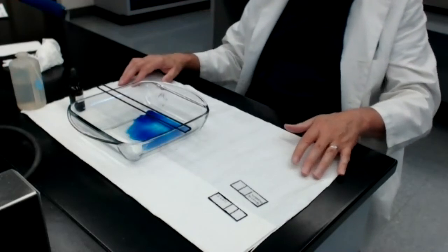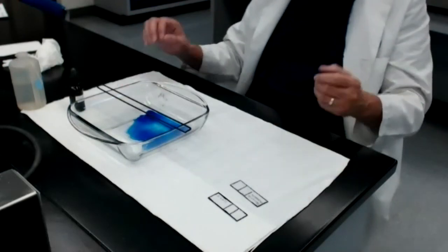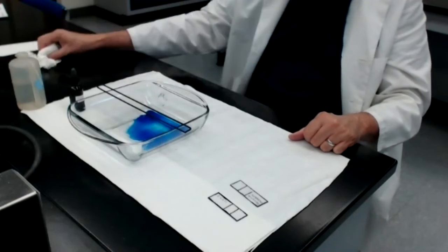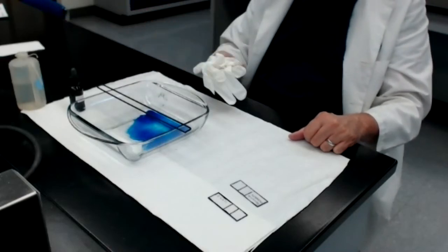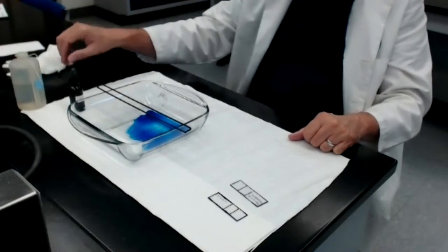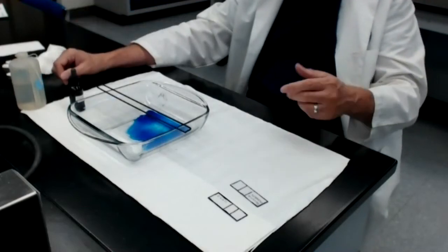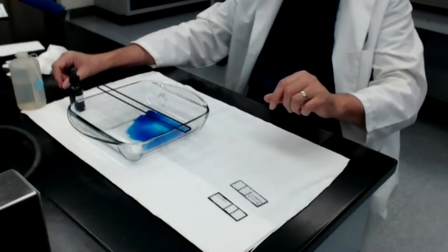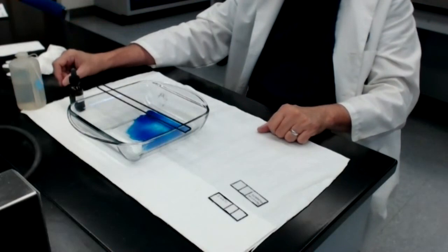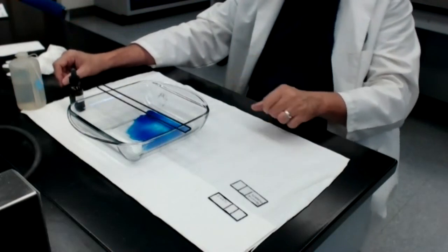Finally, you'll notice that when I handle the slides, I handle them barehanded. Usually when people do staining, they will either use gloves, which I had sitting here and I didn't put them on. Go figure. Or they'll use, as your lab manual suggests, spring-loaded clothespins, or they'll use little slide holders that are specially designed to pick up the slides and put them down.